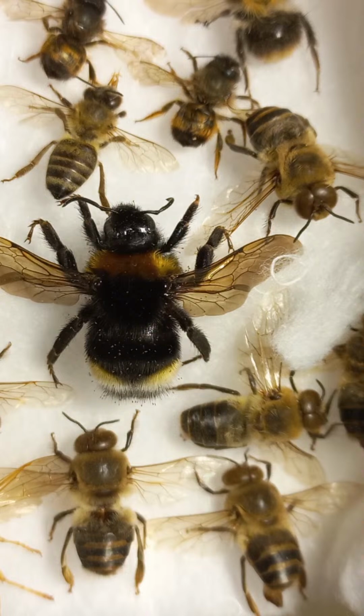What can we say about the sting of honeybees and solitary bees? Stinging insects, or aculeates, belong to the order Hymenoptera, which includes both social and solitary bees and wasps. The more defensive species are the hornets and the yellow jackets, belonging to the family Vespidae. The less volatile are the bumblebees. You can watch in the central part of the screen a bumblebee of the genus Psithyrus, or cuckoo bumblebee, and much less volatile are honeybees, Apis mellifera, and other Apis species.